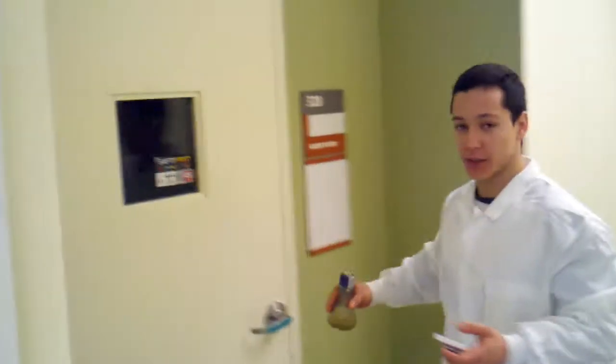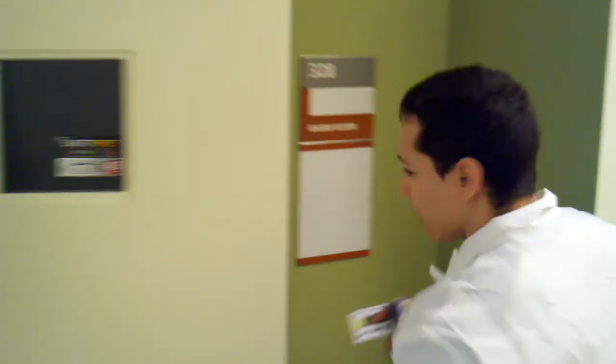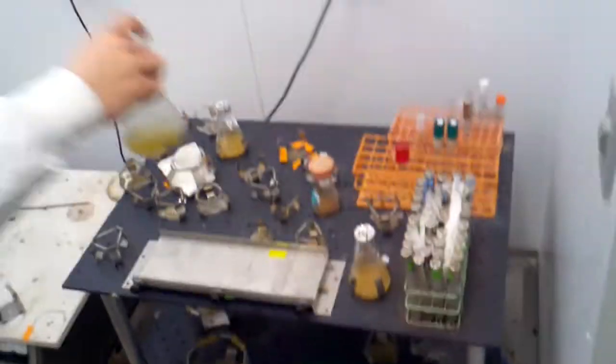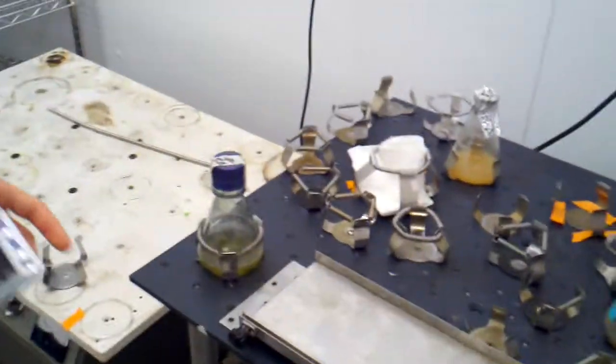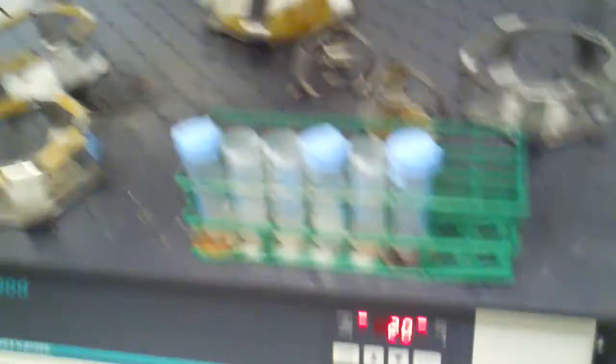So here's the 30 degree room. And we're just going to quickly come in here, turn on the light, stop our shaker right here, and we're just going to turn ourselves down, hit start again. We never want to leave one of these things off because people have a culture in there.